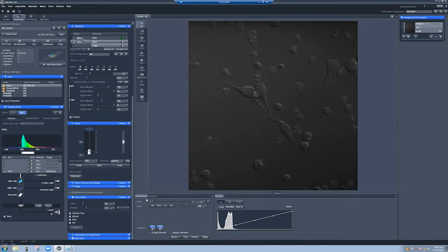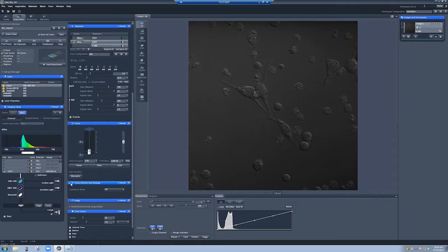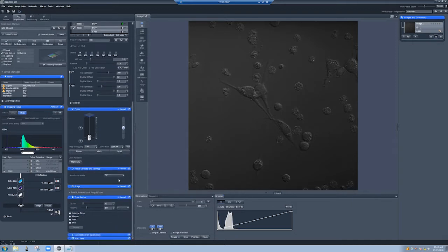So if you recall, there's a box, and when you're starting the system up, it turns on. So this is the thing that it's turning on. It's something that allows you to constantly focus on the sample in a time lapse. And the way it works is you have to click here on Focus Devices and Strategy. And in autofocus mode, you want to use definite focus. And you can tell it how often to focus. For example, if you're taking a very quick time lapse, you don't need to focus every time point. But if you're taking images every few minutes, you may want to tell it to do an autofocus every time point. So I'm going to tell it to do it every 5 images.